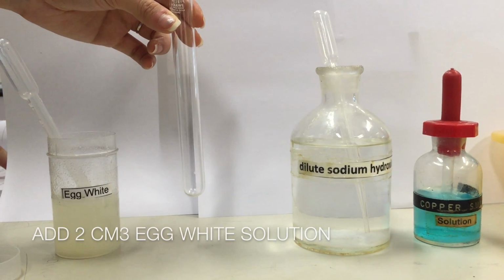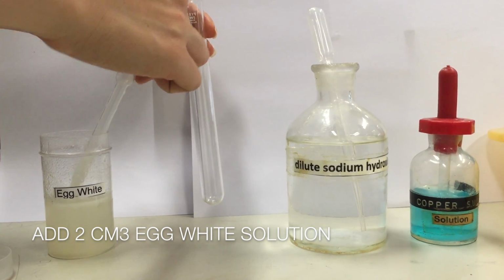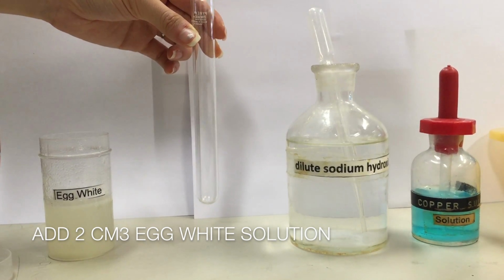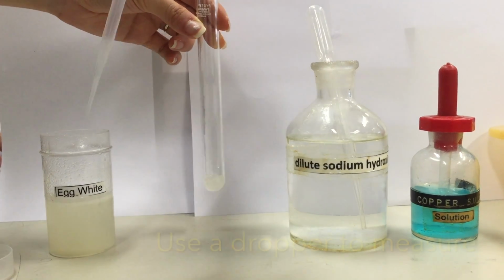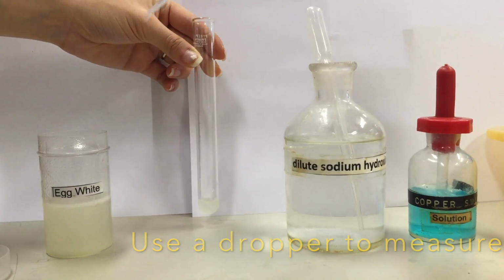We will add 2 cm cube of egg white solution into a test tube. We will use the dropper to measure 2 cm cube of egg white solution.